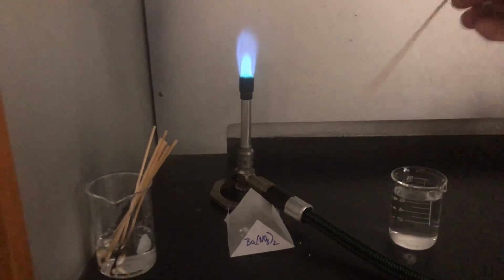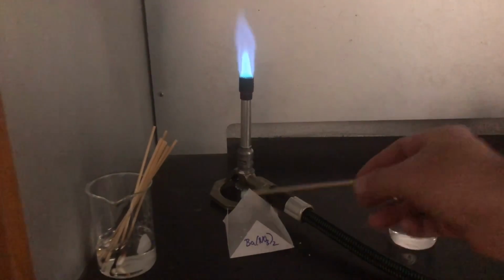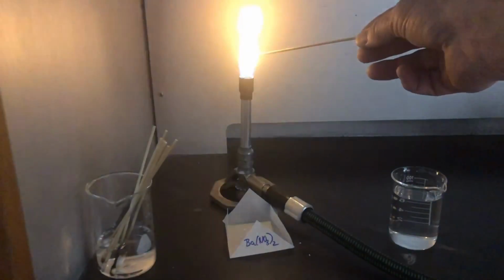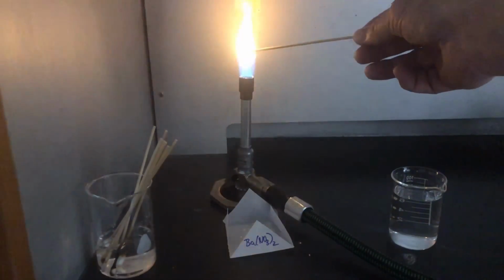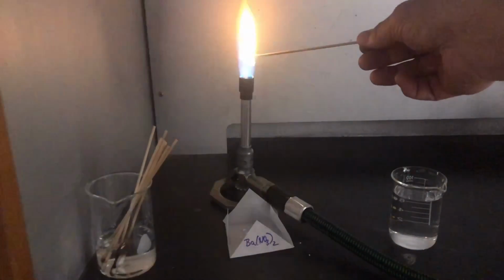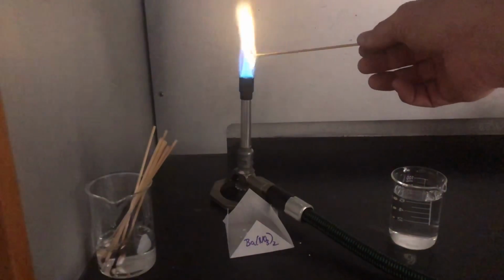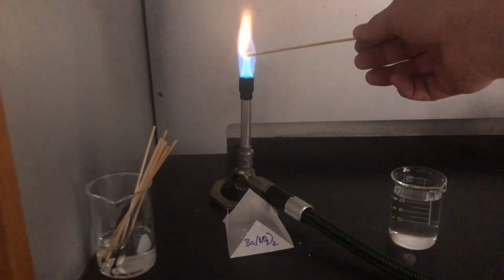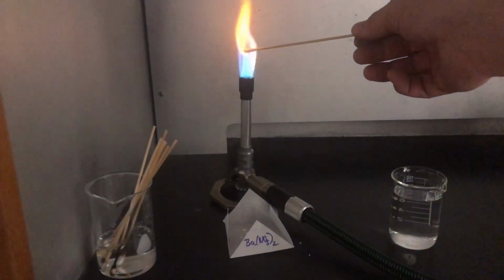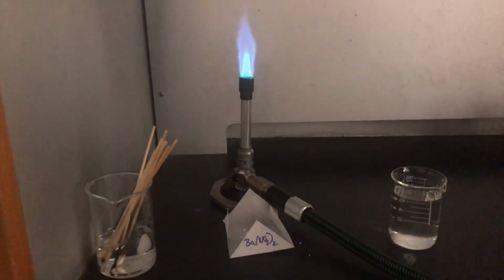So now we're going to work with barium nitrate. It's pretty bright, but it sparkles a little bit. And I noticed barely a bit of a green tinge in that. Definitely not as green as the copper, but it's a yellow, has a bit of a spark to it and a green tinge. That yellow at the end again is just the cotton.